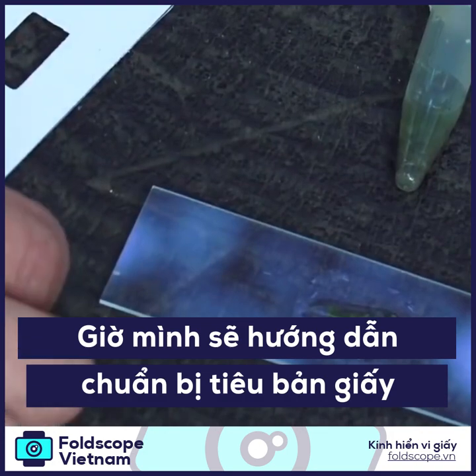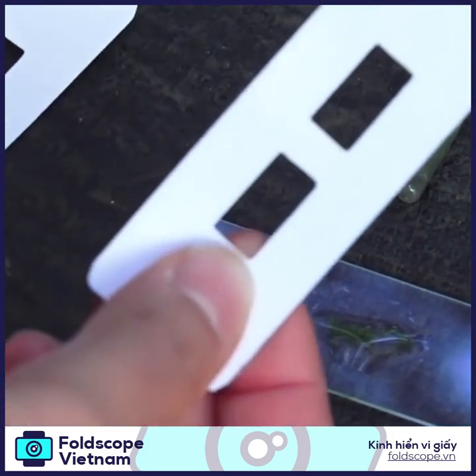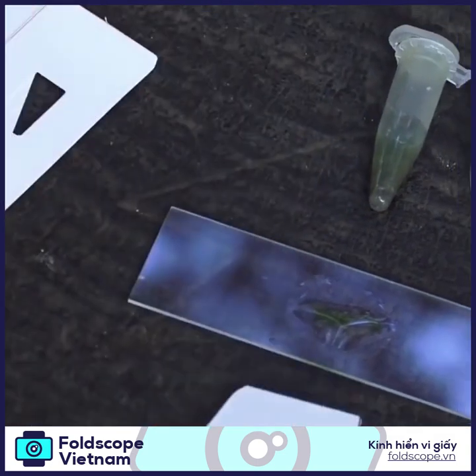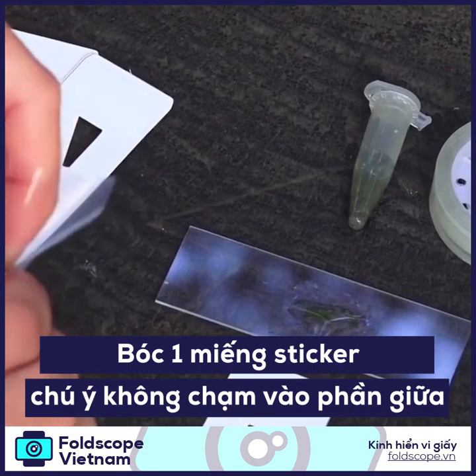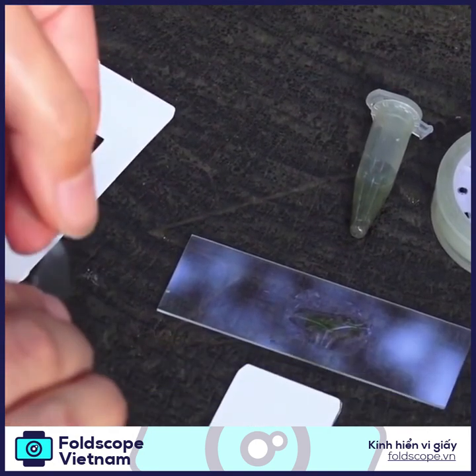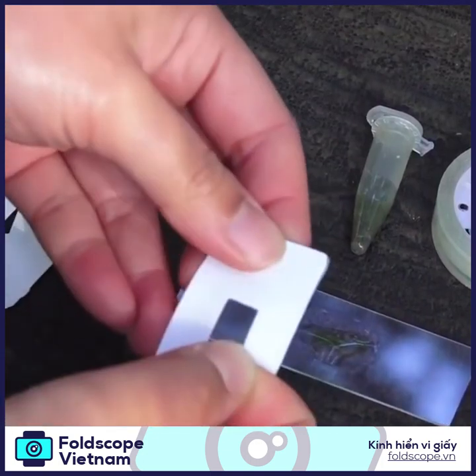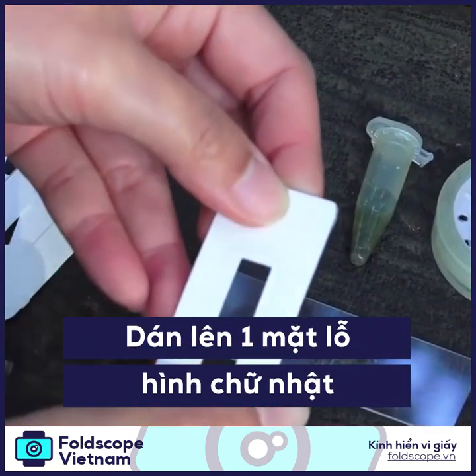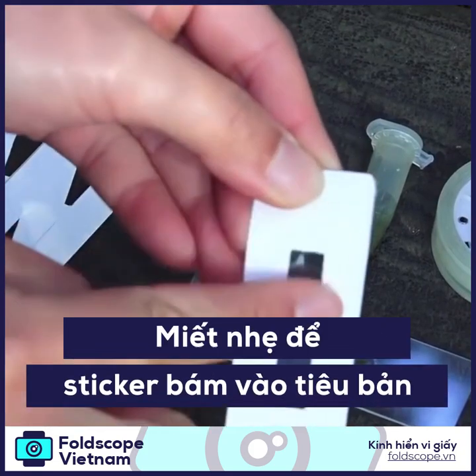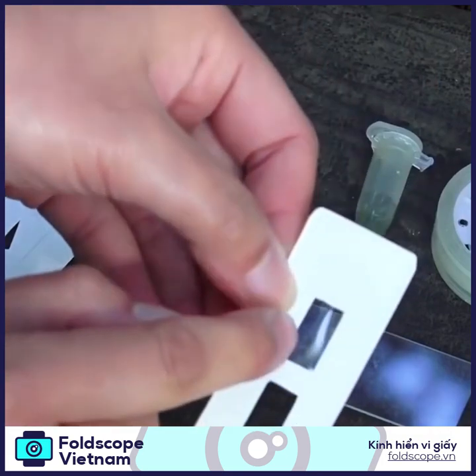If you're using paper slides, you're going to take one paper slide and put one sticker on this side. Make sure you're attaching it, and then flip it over so that this side is sticky.